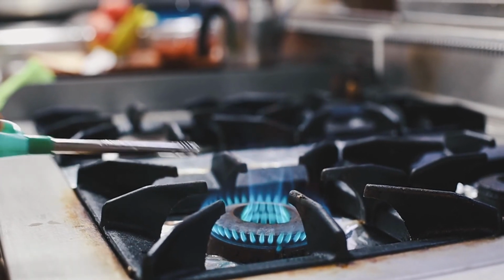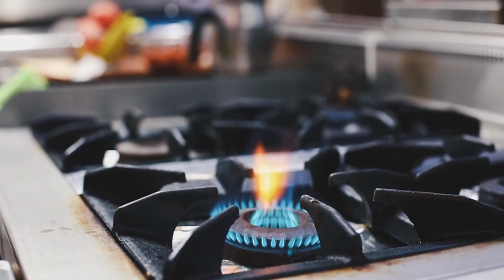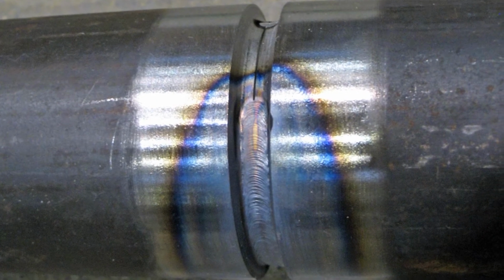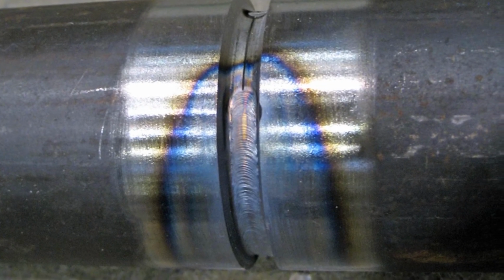If this precaution is not taken, the metal will be heated to high temperatures, forming multicolored splotches on the surface of the steel. This phenomenon is known as heat tinting and can occur on any stainless steel object heated to sufficient temperatures, which is why it's commonly reported by welders.